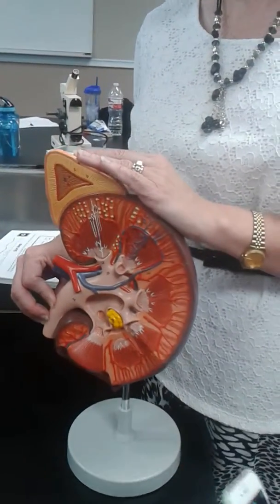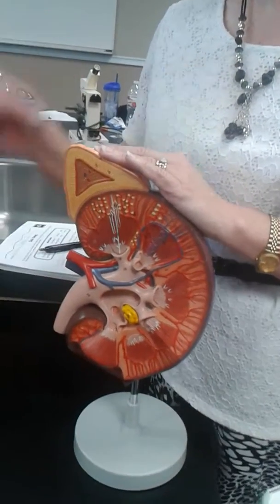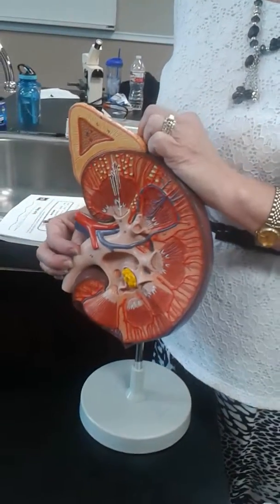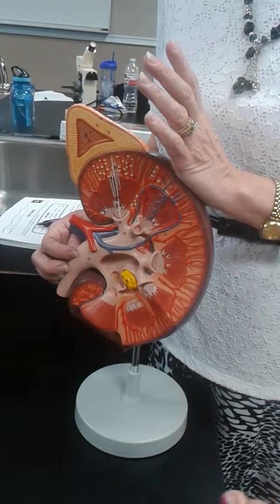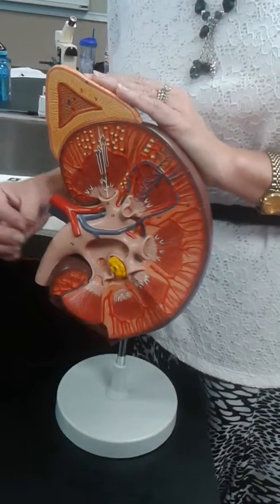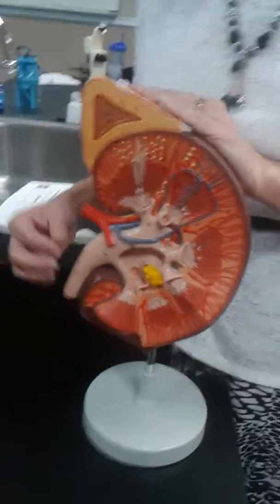But I am, and I just got that. Oh, sorry. The urethra is going to the outer part of the body. This is going to the bladder. So this is the ureter. And I know that at least half of you are going to get those two confused. Not me. Every time: urethra, pee hole. The ureter is what comes out of the kidney. Okay, so this is the ureter.